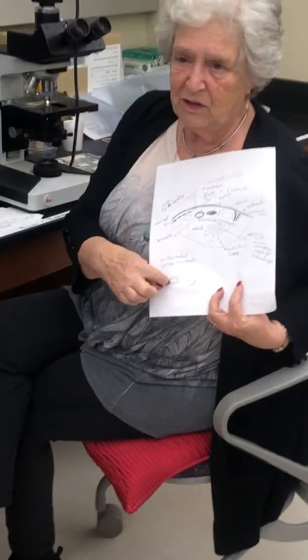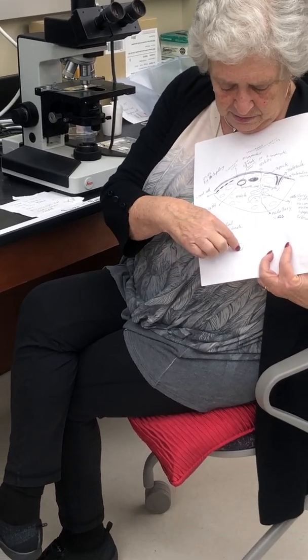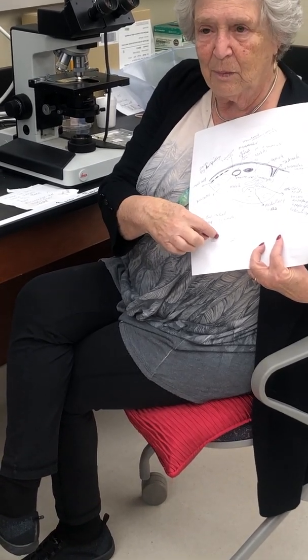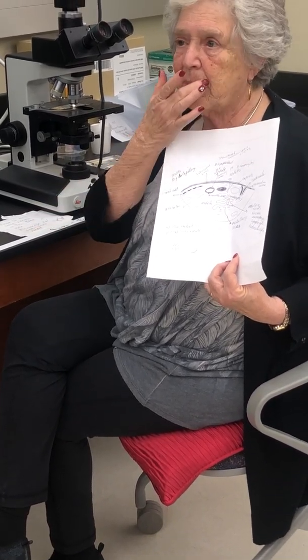Can you see how we're imagining that these are postcapillary venules? This one's the postcapillary venule, and this is the regular venule. See how the nucleus of the endothelial cell is just sort of flatter? And this one, see how they poke out almost like a little mountain coming out? That's the postcapillary venule. When it says high endothelial cells, they just mean that the nucleus looks high, taller than the average one.